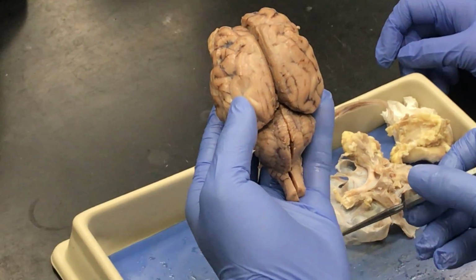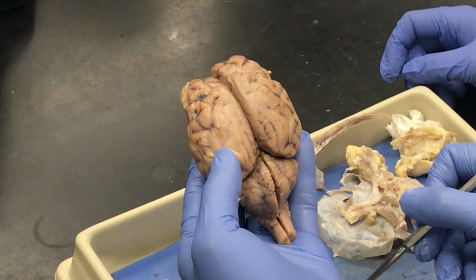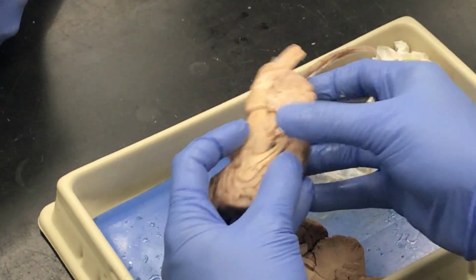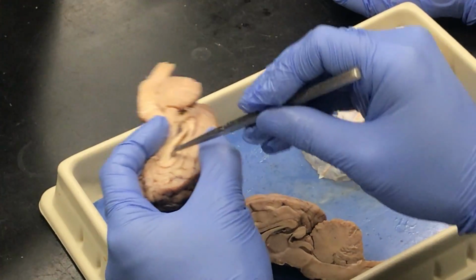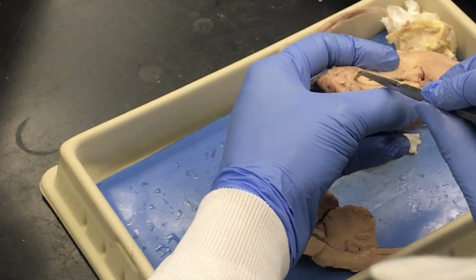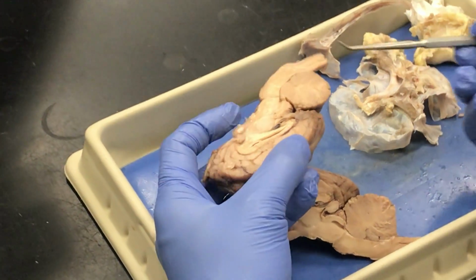Crista galli. That's a skip. Tentorium, we already went over. Then the corpus callosum. Corpus callosum, so you have it in half. And what you can really look for now, I had many of you open up the lateral ventricle as a space of the lateral ventricle. And you can see that lighter color, the white matter just superior to the lateral ventricle, is the corpus callosum right here. And then on the cerebellum, the vermis.